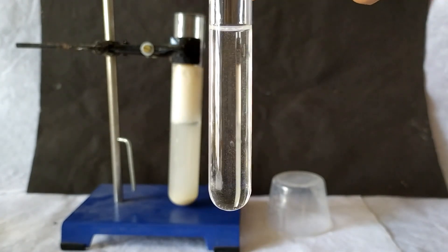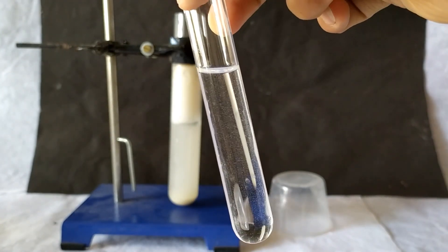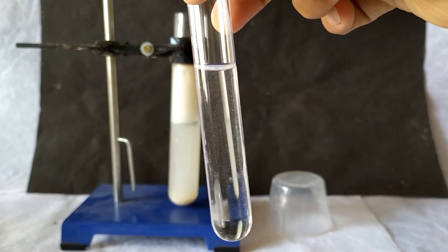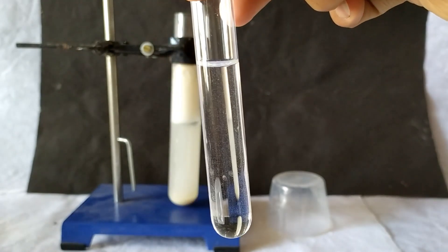Calcium carbonate readily dissolves in a mineral acid, in this case hydrochloric acid, to form its corresponding soluble salt, in this case calcium chloride solution.